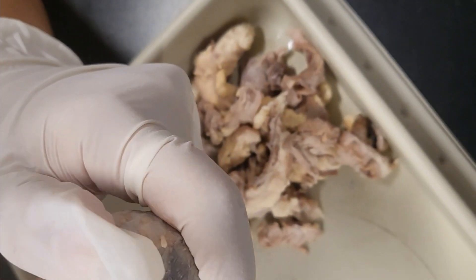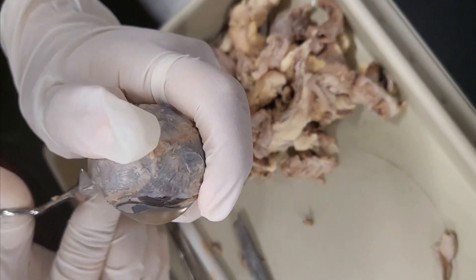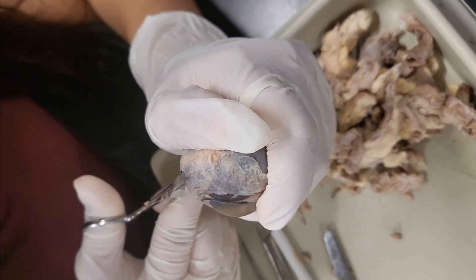Oh, you need the juice? The juice is leaking now. Could you change this light so I can see where I need to stop?